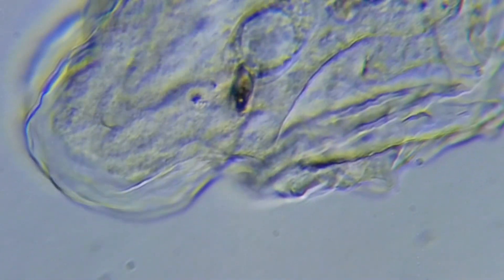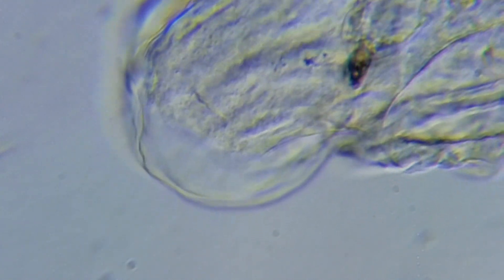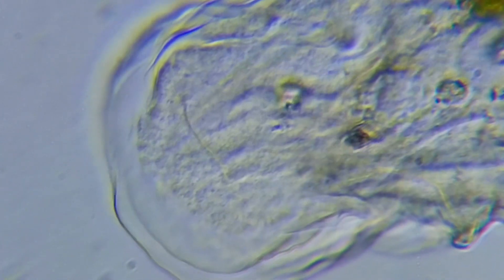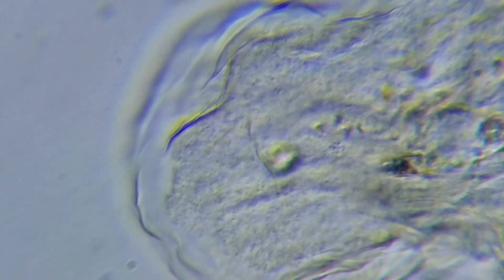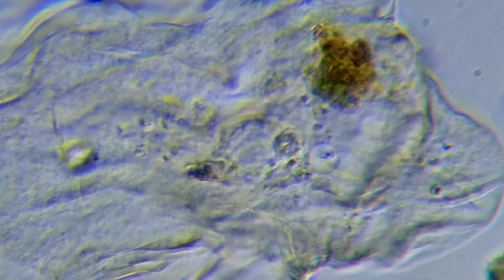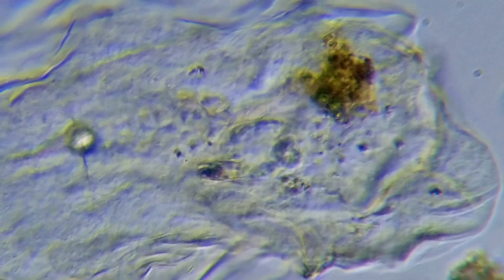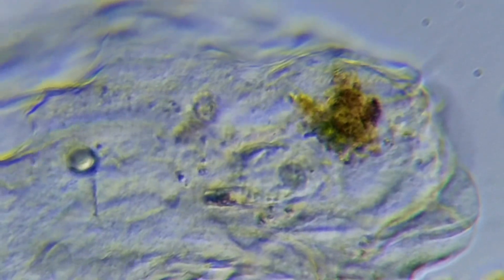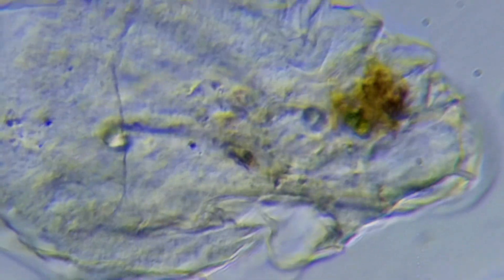Here we're looking at this at a thousand power and we've changed our filter a little bit. You can see this kind of grainy material which looks like sand — it reminds me of sand in an hourglass because it'll move in one direction, then move in a totally different direction, back and forth. That's how it moves, kind of like a snail. The snail moves forward with his head and then pulls the rest of his body with him, and amoebas are like that too — they move in one direction and pull the rest of their body with them in a slow fashion.